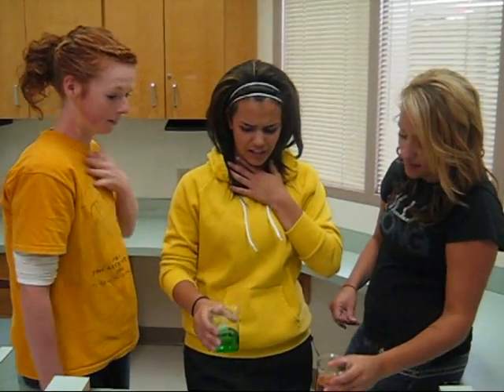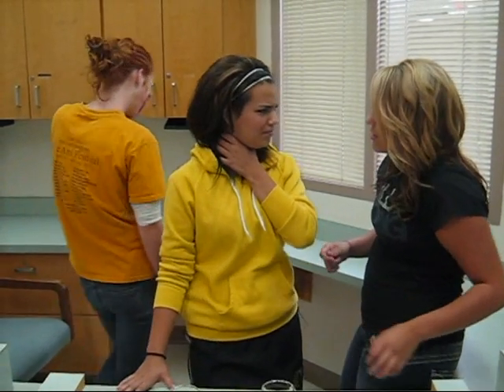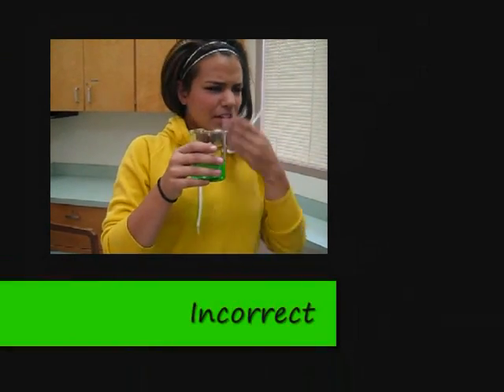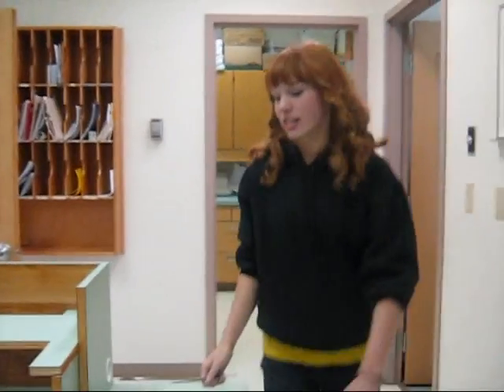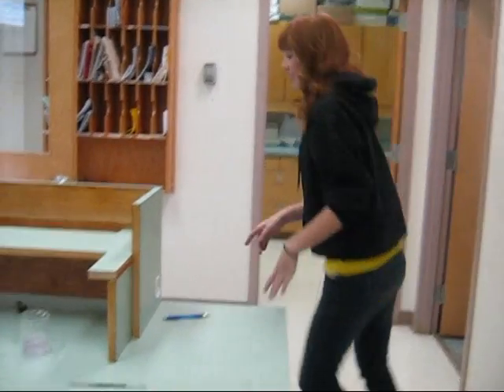Oh, I couldn't breathe it in. I think I inhaled too much. My throat doesn't feel good. It doesn't feel good, guys. What's the experiment? Oh, just wait, forgot my book, sorry.